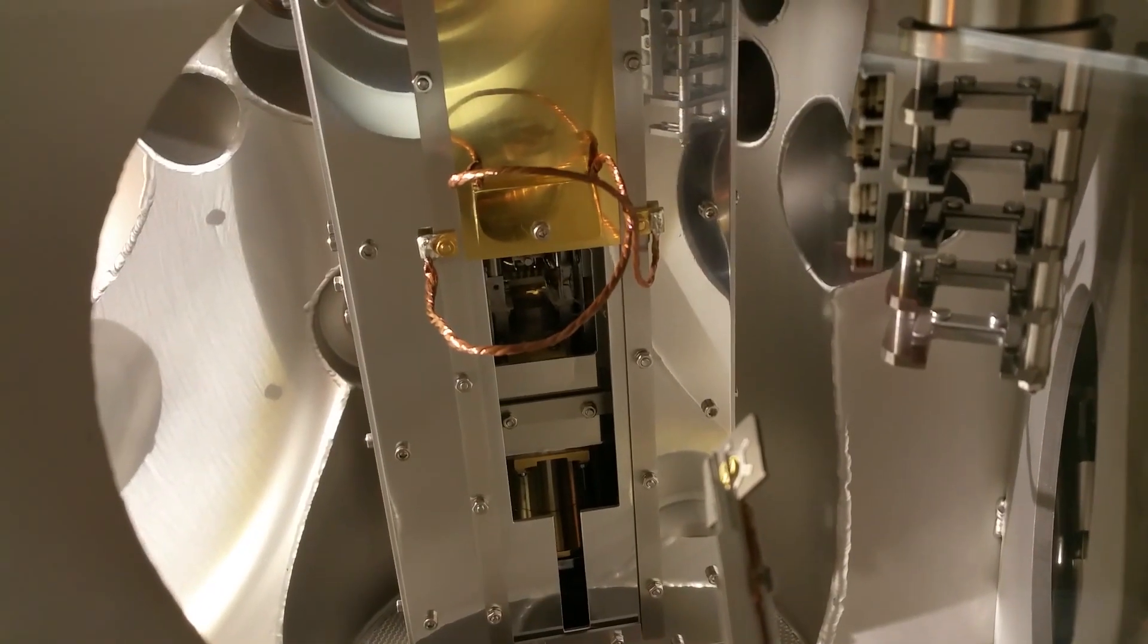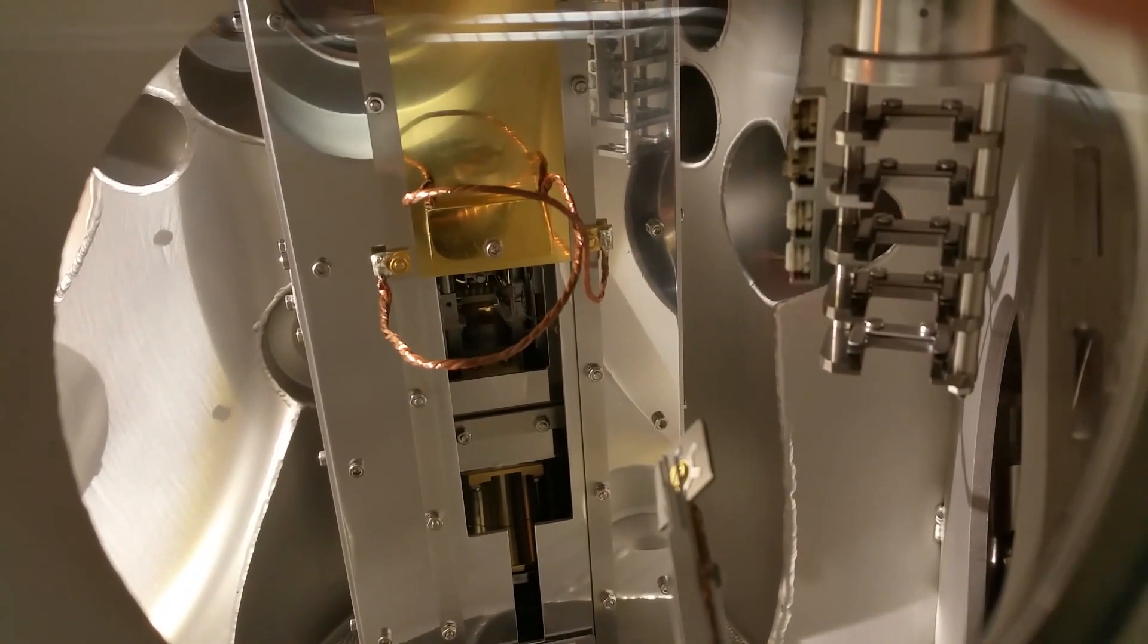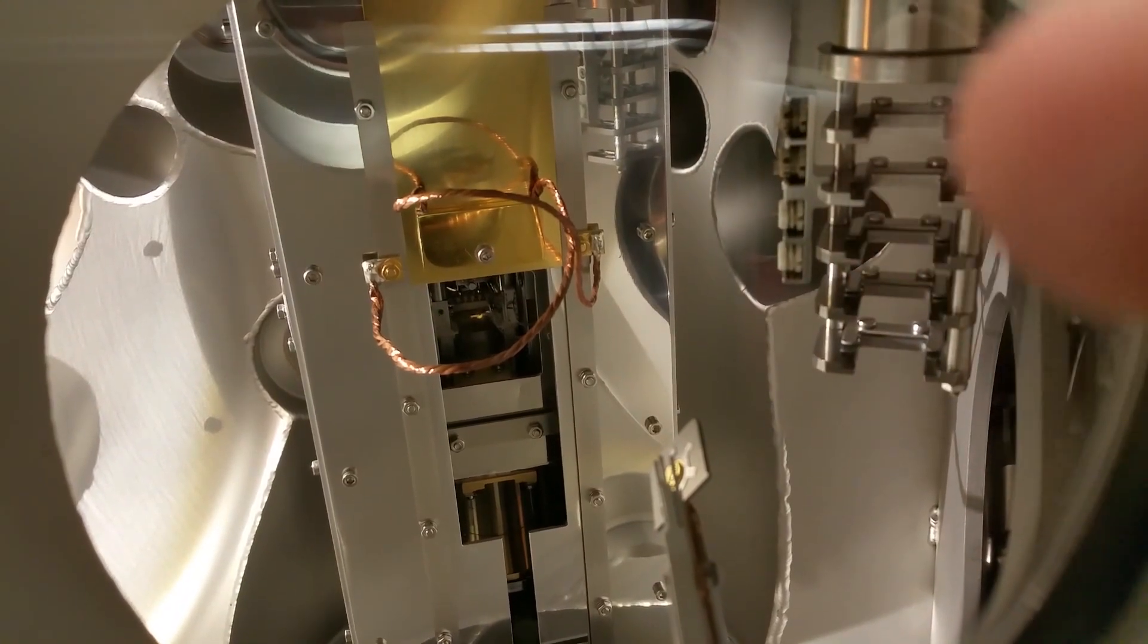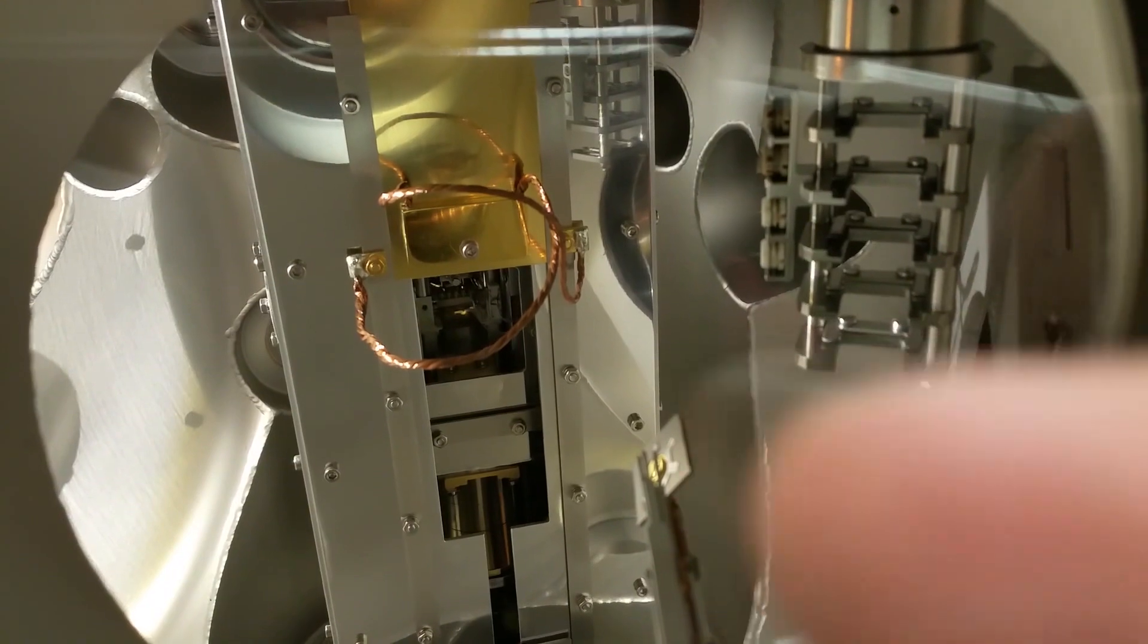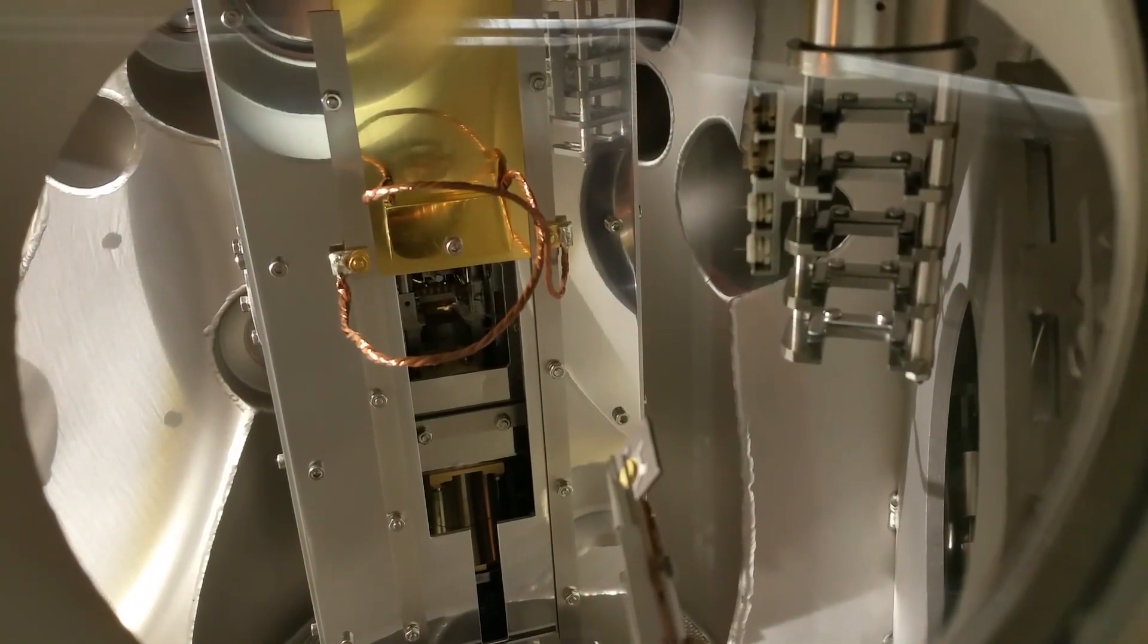This is what it looks like in the STM chamber where you have the sample garage right here, and that's the STM there. This is a sample that we can transfer in using this wobble stick.